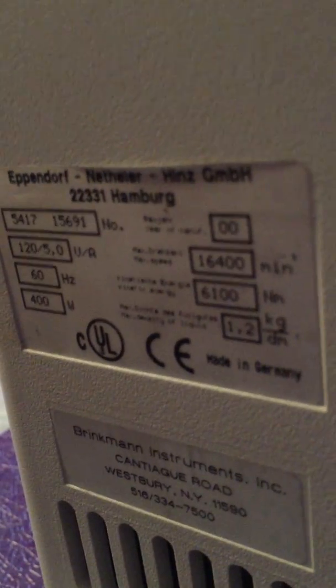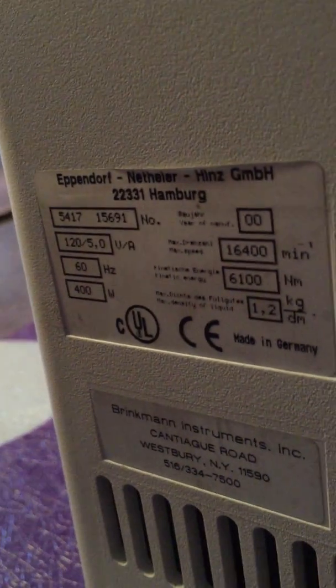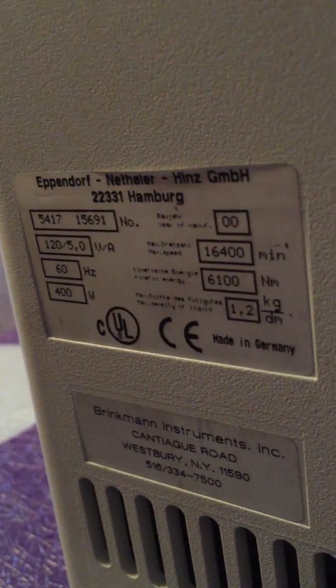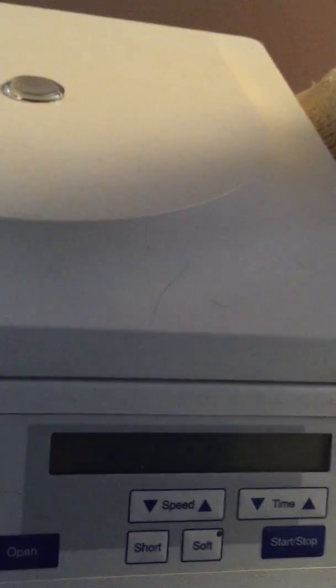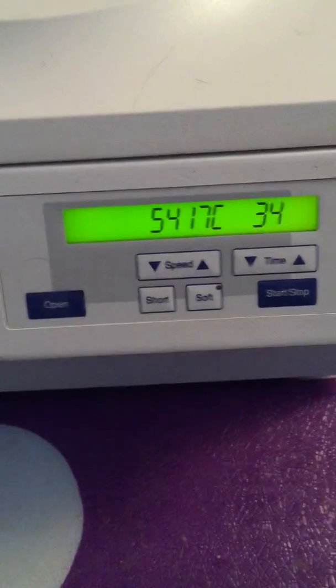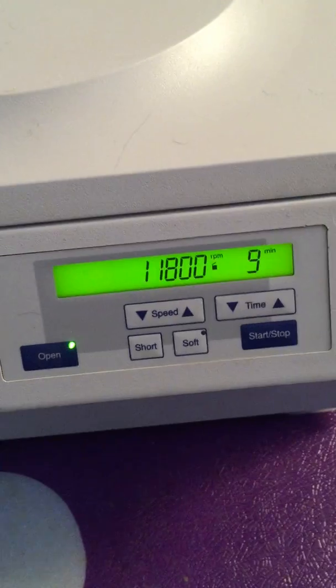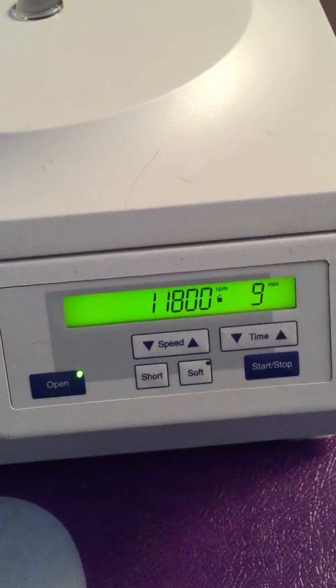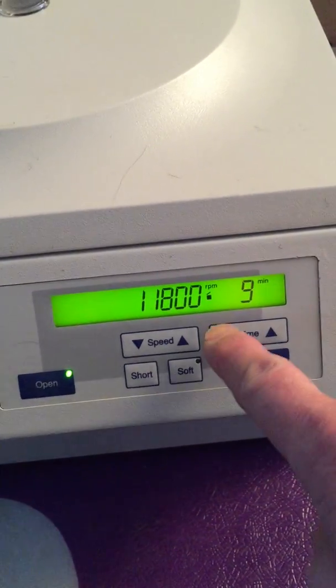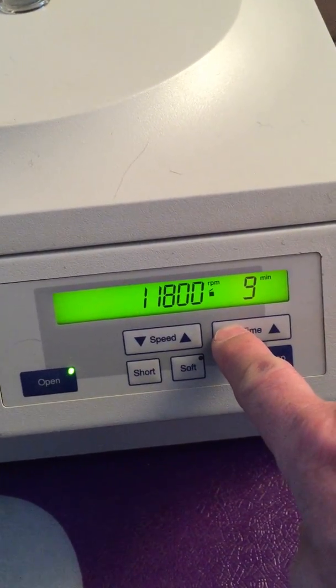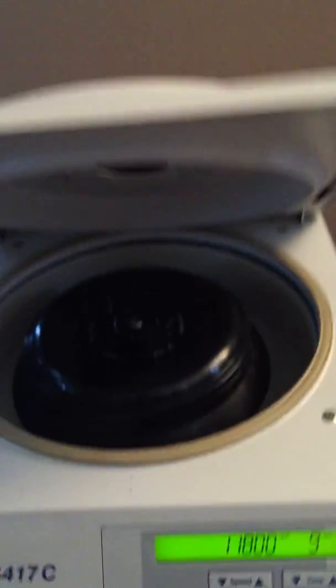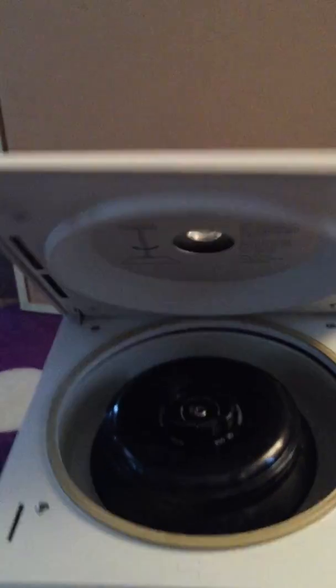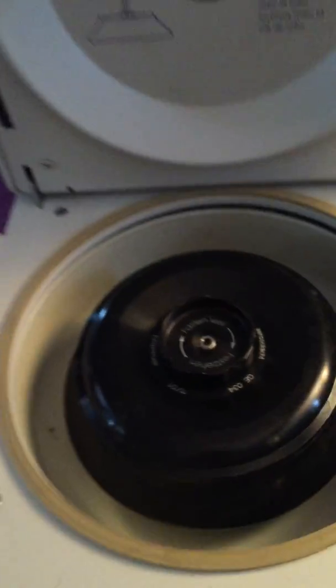Let me power it up and let's see what the display says and let's have a good run here. All right, so there we go. We can set the time. Now let's open the lid first. Show the lid opens.